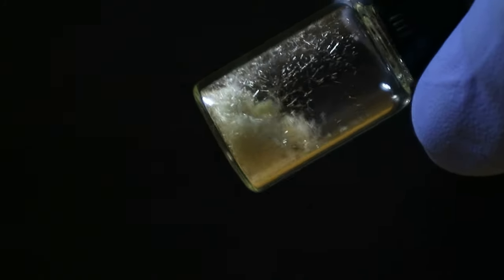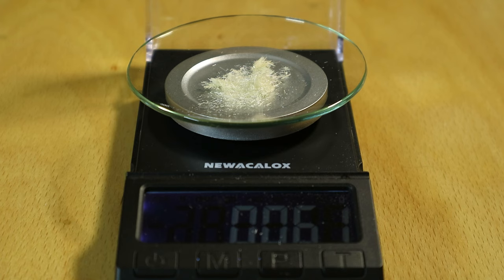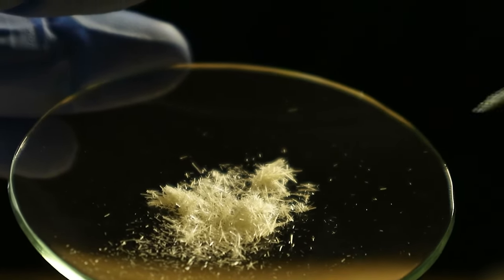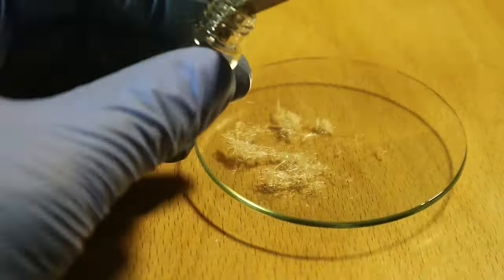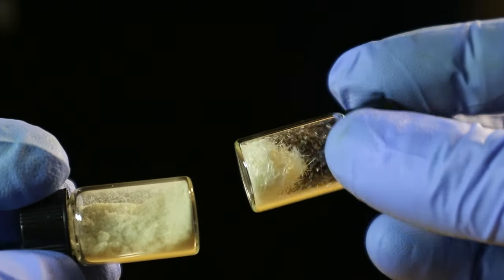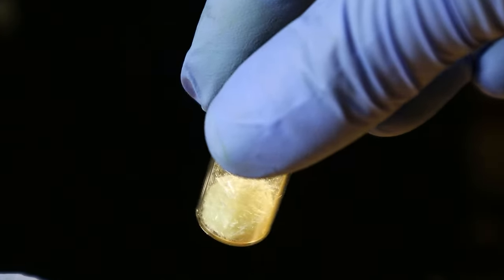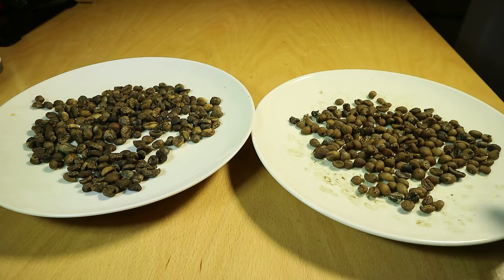There are two possibilities: either the rest of the caffeine is still in the beans or it is in the coffee water — or a combination thereof. If I had to put my money on it, I would choose the aqueous solution. I repeated all of the steps — extracting from the water using ethyl acetate, distilling the solvent out, recrystallizing — and we pretty much got the same amount the second time around as well. This proves that it's all still in the water. But since caffeine is only slightly more soluble in ethyl acetate than in water, the ethyl acetate can only pull so much out in a given volume. We would need to tweak the ratio, probably by increasing the amount of ethyl acetate. Also, as far as I know, the indirect method is usually reserved for when dichloromethane is the solvent of choice, since caffeine is more soluble in DCM than in ethyl acetate, which would increase the yield from the liquid-liquid extraction.